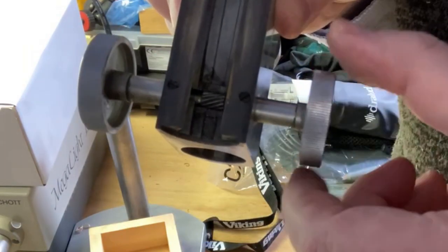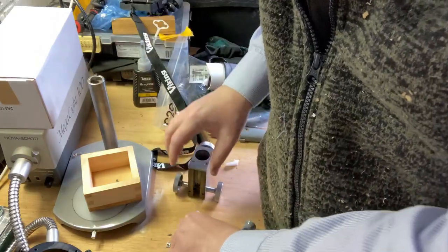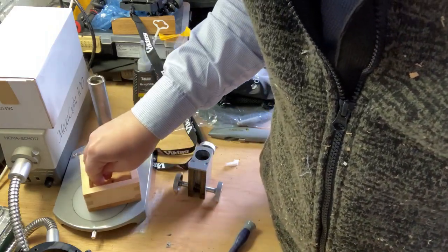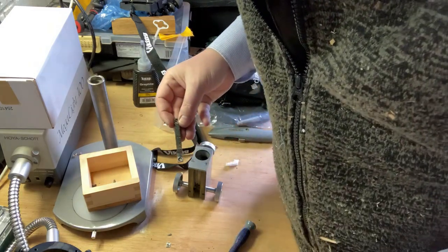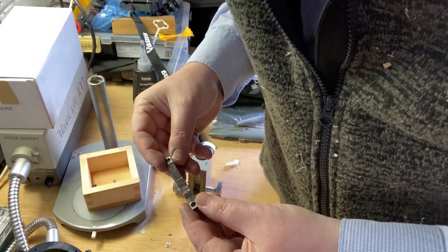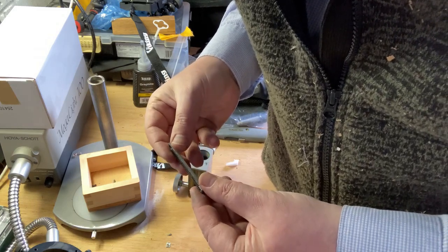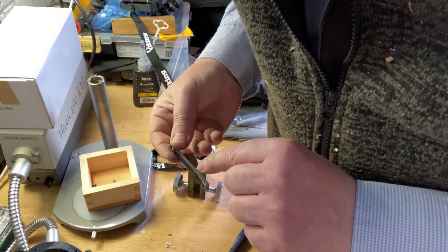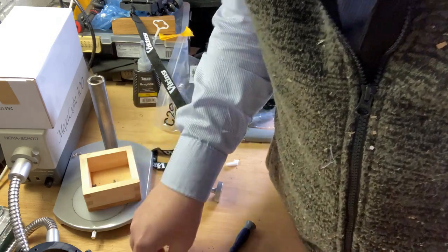The other part that I'm considering doing, if you have a look at here, you can see that this is actually in place. So this is the strongest material, this is the weakest material. I can analyze this to find out what it is. It might be a brass, but yeah. So I need to repair that or replace it.